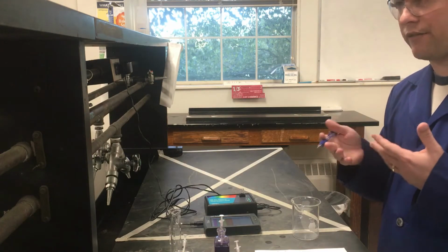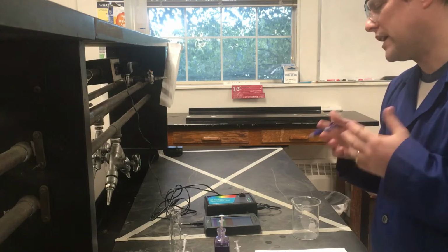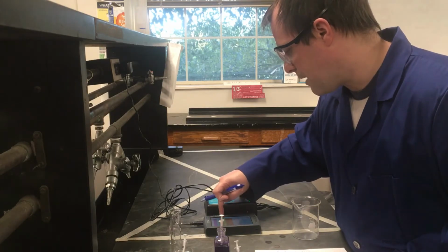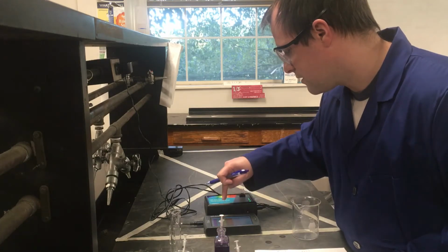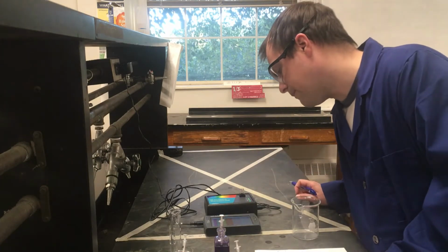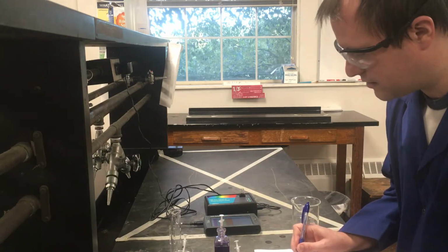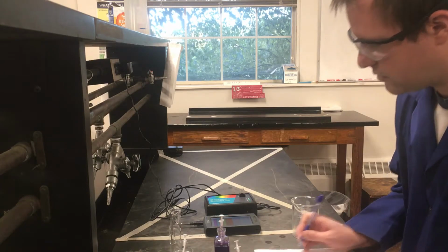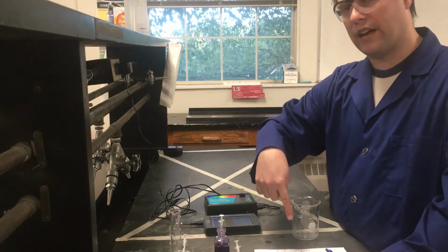And usually it's somewhere around 585 to 590 nanometers for the units. So that's what I'm looking for. In this particular case, if I look at this one, where my maximum's at, if I try to get to where I think it is, it looks like for this one it's about 589.6 is what I'm getting. So I'm going to write that down as a lambda max, 589.60 nanometers.